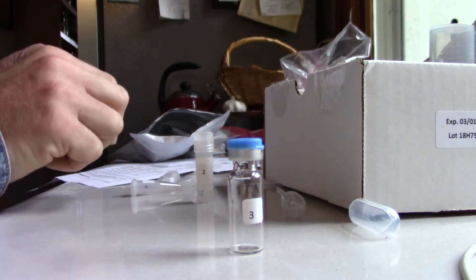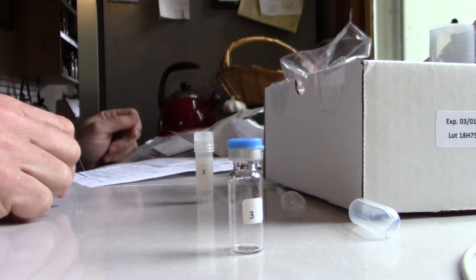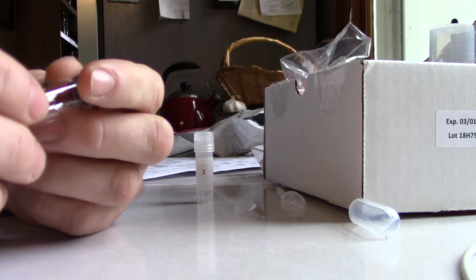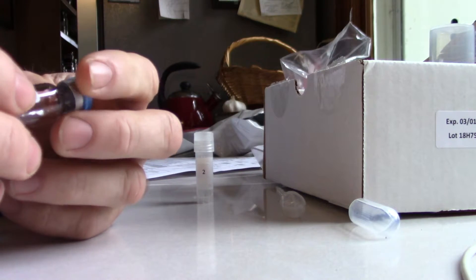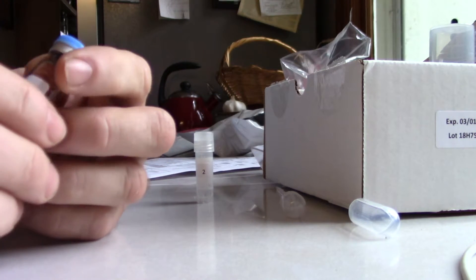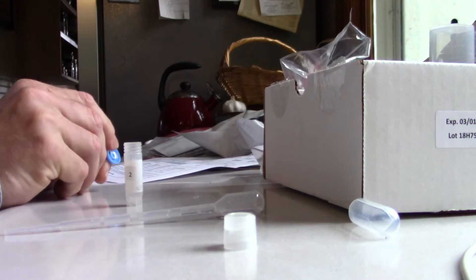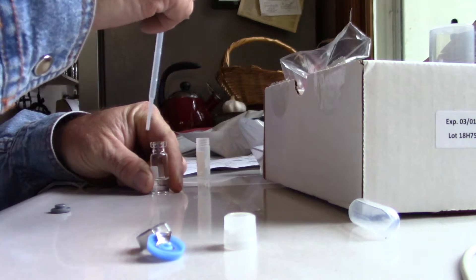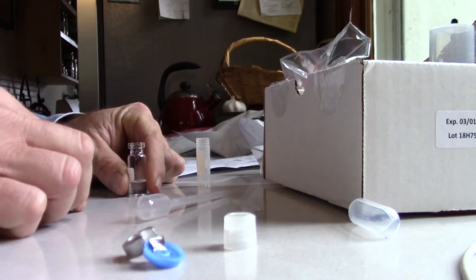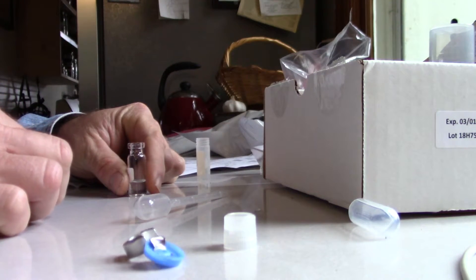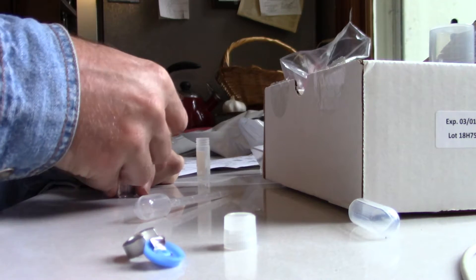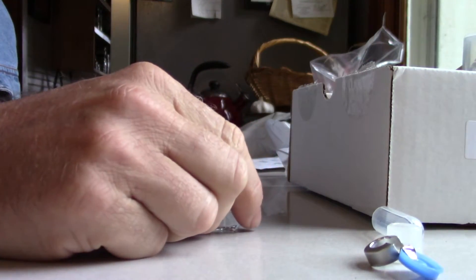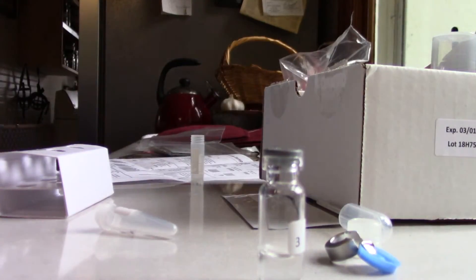So this is vial number three. Vial number three contains a small amount of liquid reagent. It does. Use the same cap and shake for 30 seconds, allow to sit for 10 minutes.